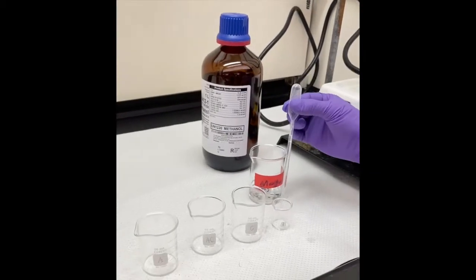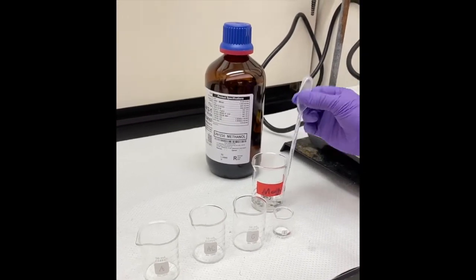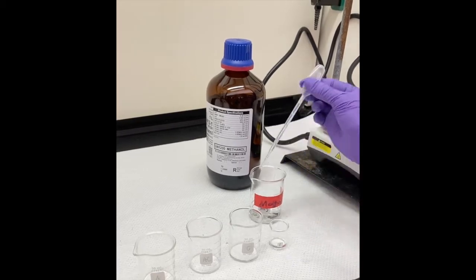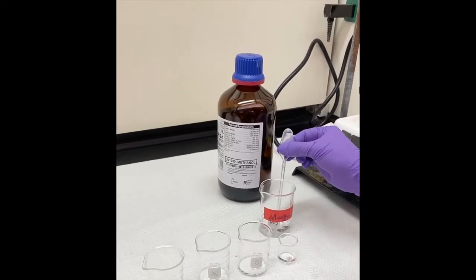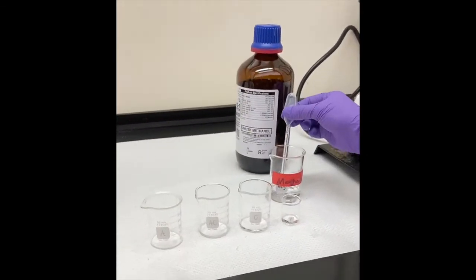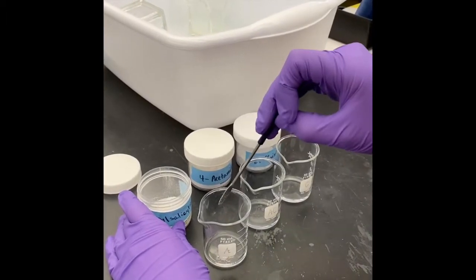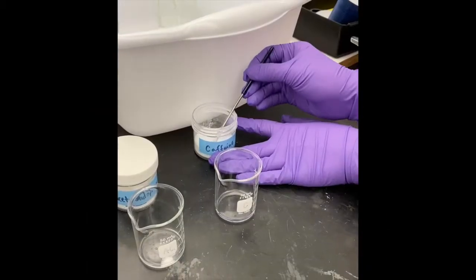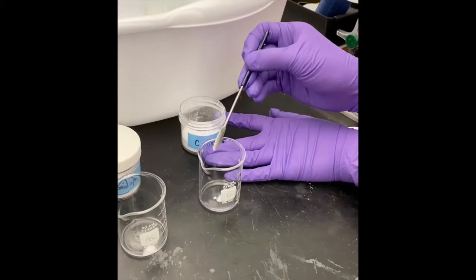You will begin this lab by creating your solutions. In four separate beakers, add two milliliters of methanol using a pipette. Add a micro scoop of acetylsalicylic acid, acetaminophen, caffeine, and your unknown compound to the two milliliters of methanol.